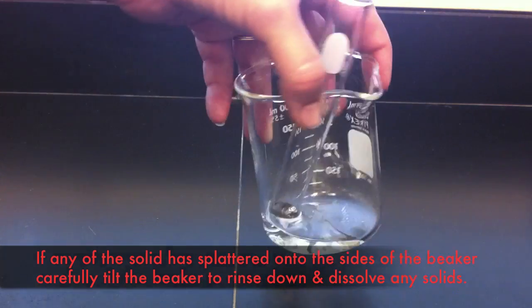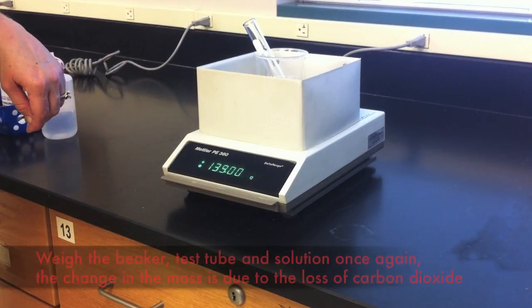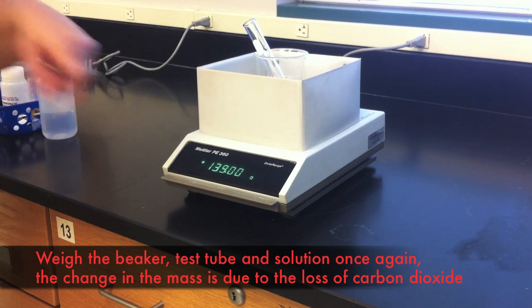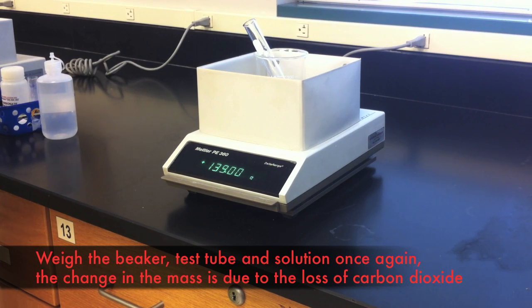Once the reaction is complete, re-weigh the beaker, test tube, and solution. The difference in mass is due to the carbon dioxide that has been driven out of the solution.